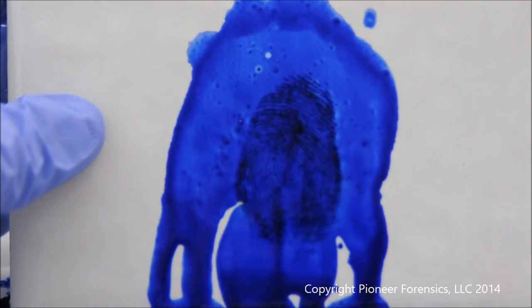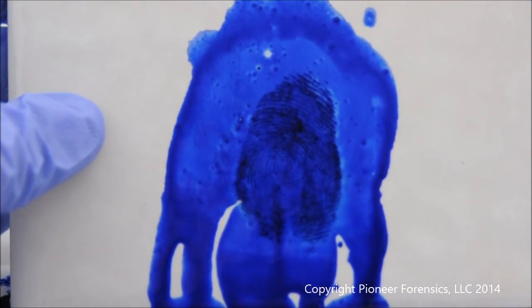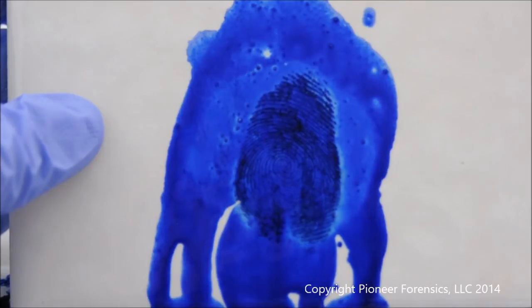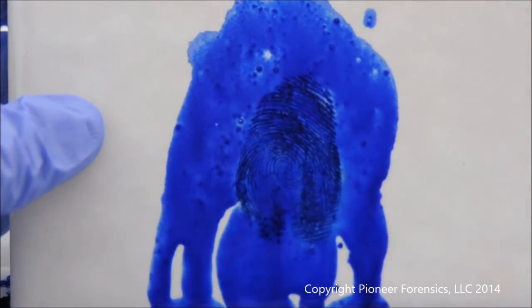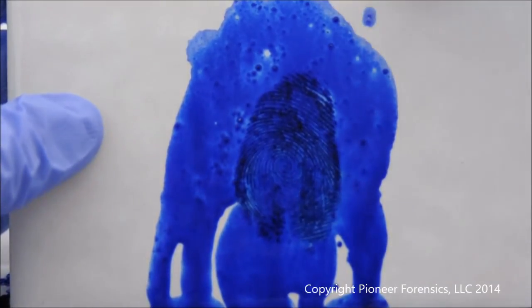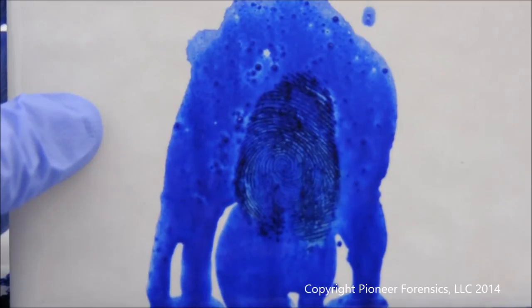Again, caution needs to be used with this dye stain. Anything it comes in contact with is going to retain that blue stain appearance. If you make any contact with anything that you need on your evidence that is going to be detrimental to using this blue stain, a secondary rinse and or reagent should be considered in the applications.